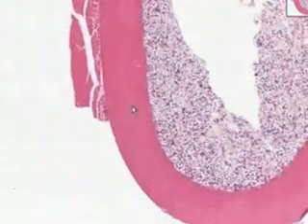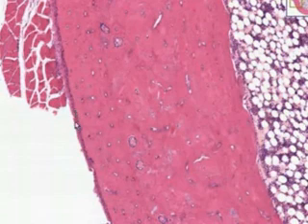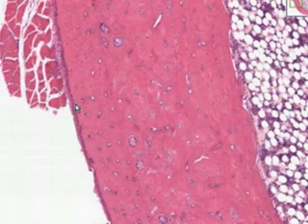Let's take some of this dense cortical bone and take a look at it and see what we could identify here. Well, the first thing you could see is that there is a pretty good little peel of fibrous connective tissue, dense fibrous connective tissue, over the outer edge of the cortical bone, and that's periosteum. Even though periosteum does a lot of magical things, basically it looks pretty boring. It looks like just a little piece of fibrous connective tissue.